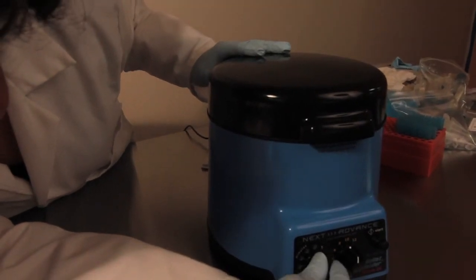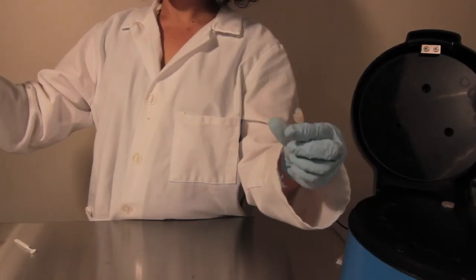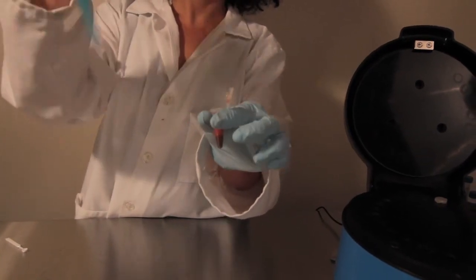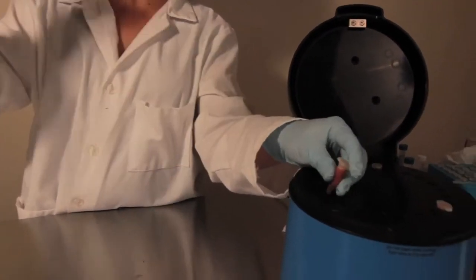Immediately after your sample is homogenized, add the remaining volume of trizol required by the protocol, and vortex by running in the Bullet Blender at speed 2 for one minute.